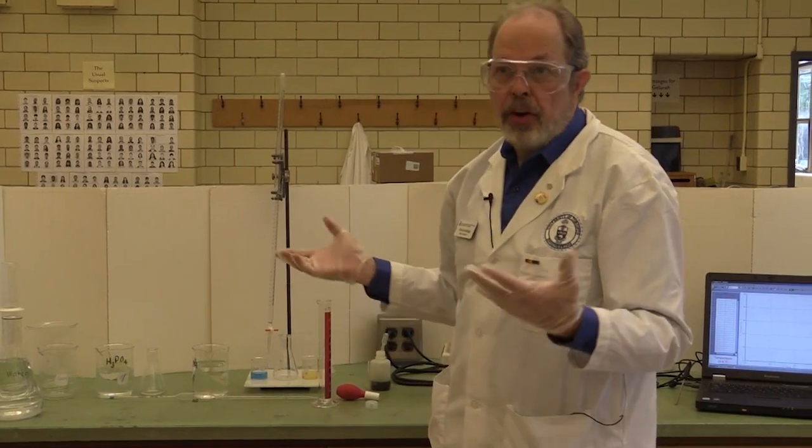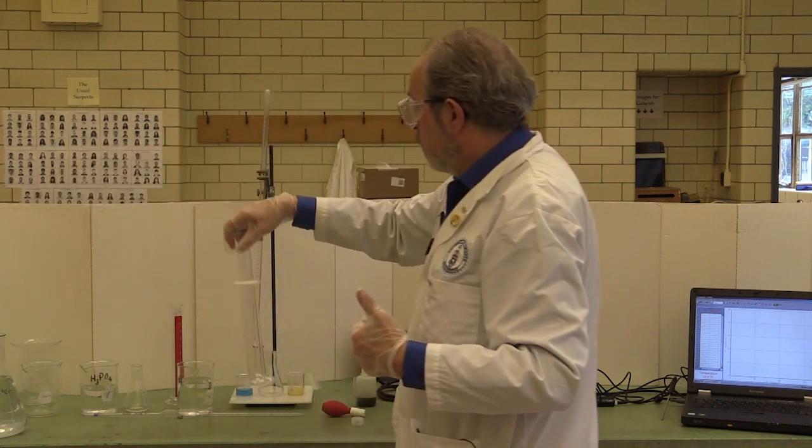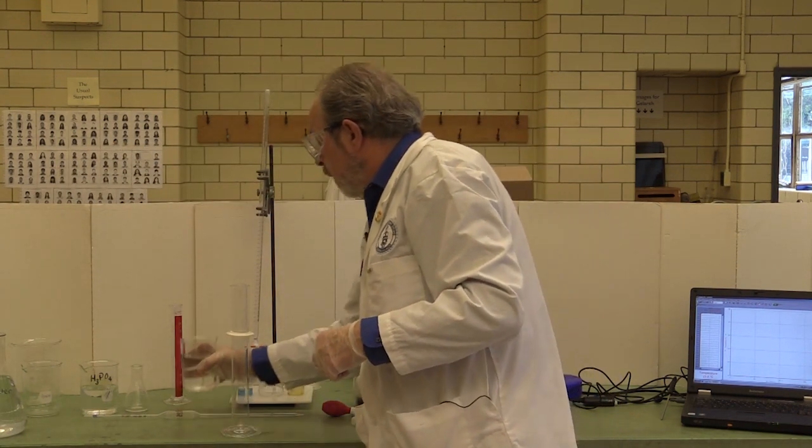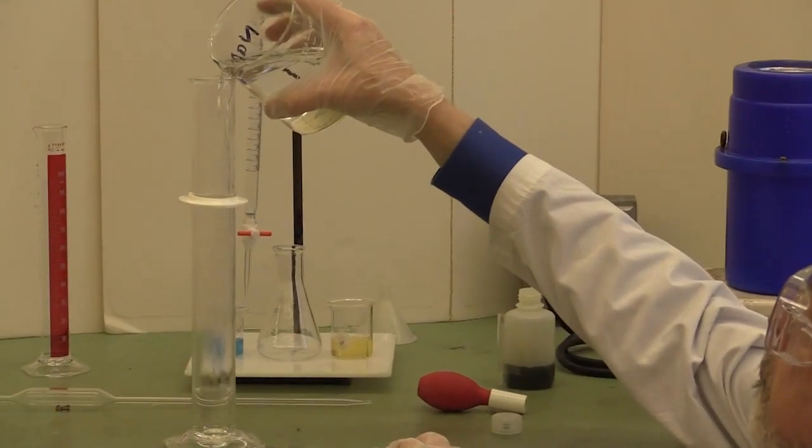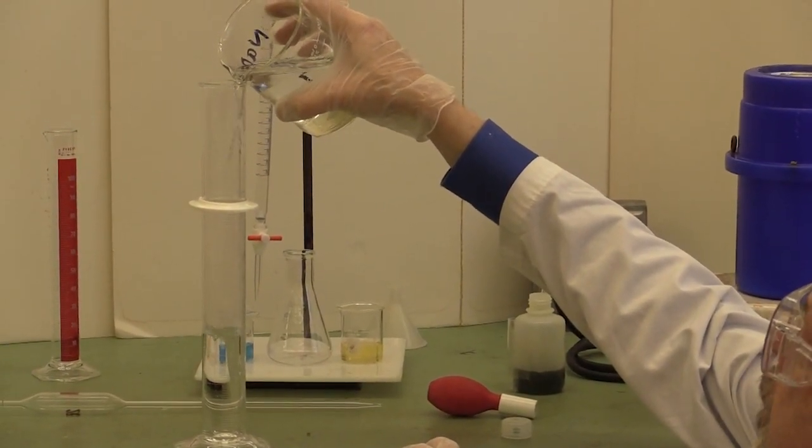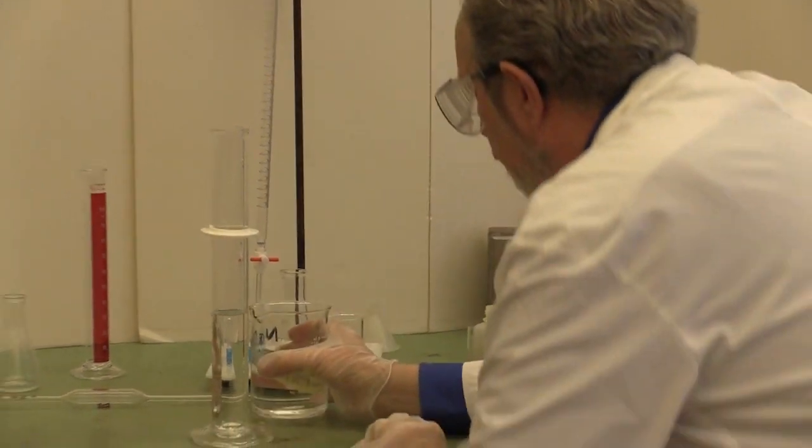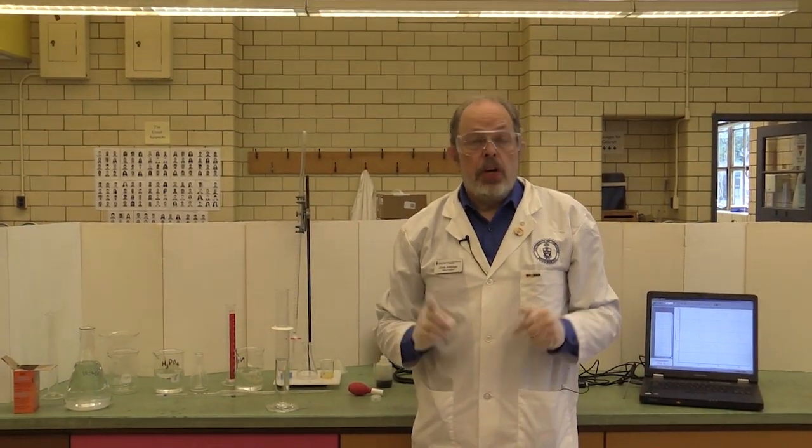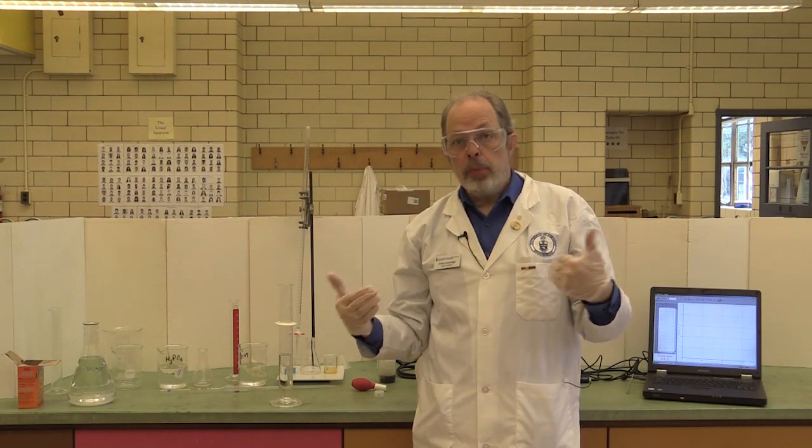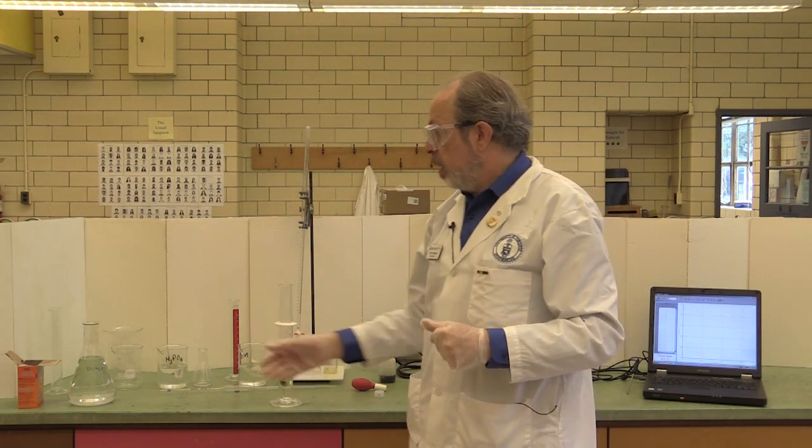As I said, we determined from the calculations, say, that it's 120 mils of sodium hydroxide that I need. So again, dispense 120 and we'll use a larger graduated cylinder this time. 120 mils of sodium hydroxide. And you make up the volume of the sodium hydroxide in all of these runs to 375 mils. This means that the total volume of liquid in the calorimeter during the reaction will be 500 mils. So you make it up using water.